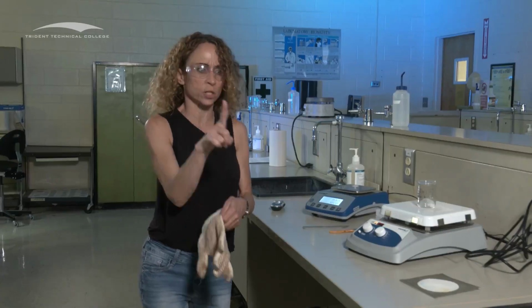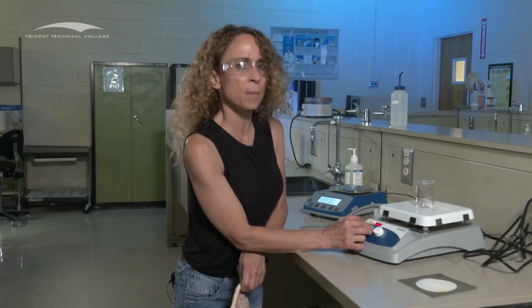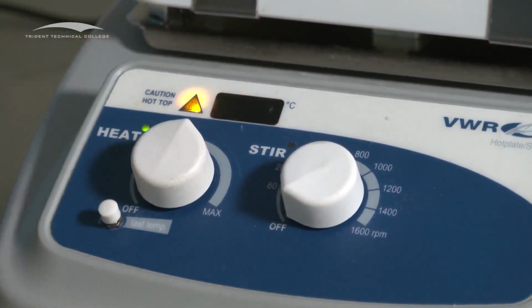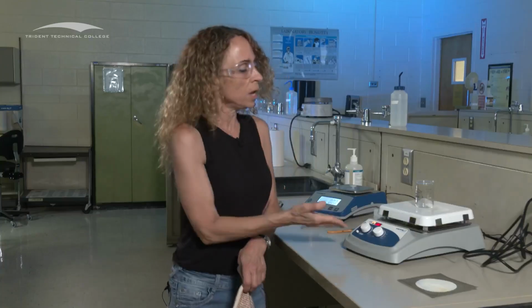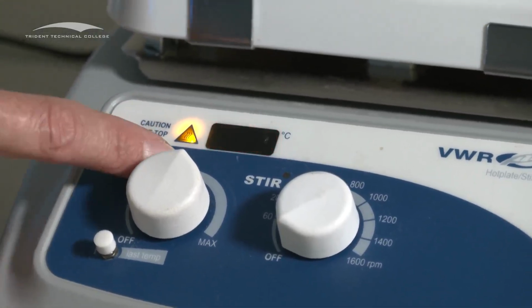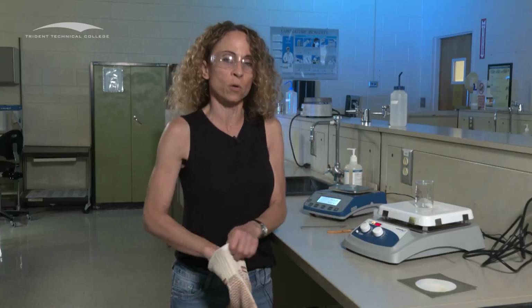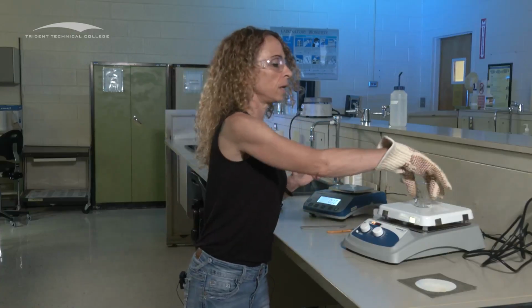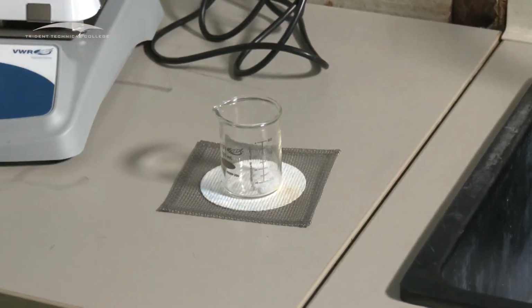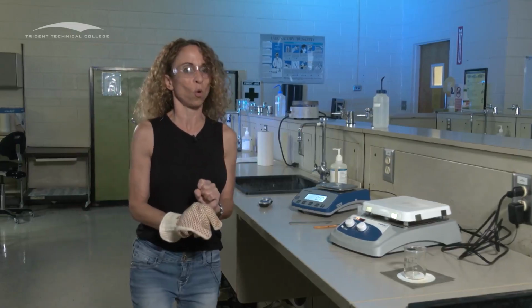Now also note this, you need to crank up the temperature at this point, okay? We're going to crank it up to 250. So crank up that temperature first. Let it adjust, okay, 250, 260. It doesn't have to be perfect for this part. Then when this stops flashing, your temperature is ready to go. For the sake of time, I'm pretending we're there. Put it on there for 5 minutes, and now are you going to touch it? No, you're not. You're going to put it on your oven mitt, and now are you going to put it on the bench top? No, you're not. You're going to put it on the wire gauze for 5 minutes. Let that thing cool.